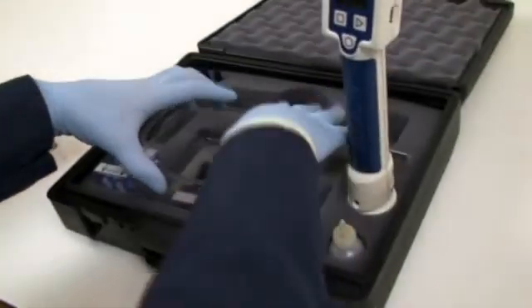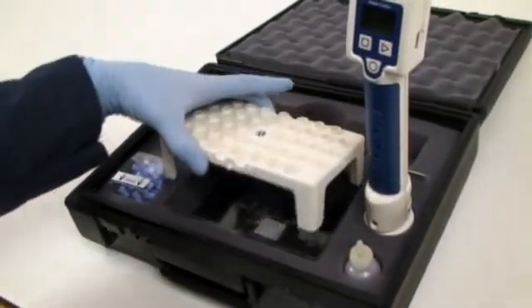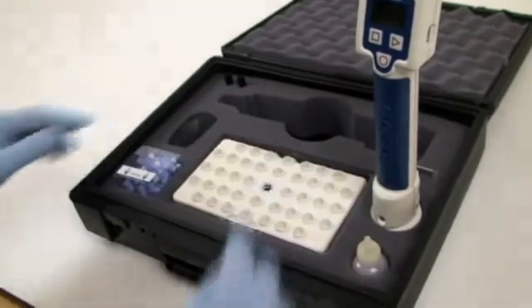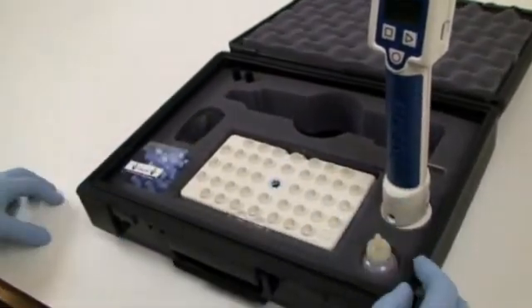Then, put your container back. Set your tray in, and then you can put fresh nibs in there, and you're ready to go.